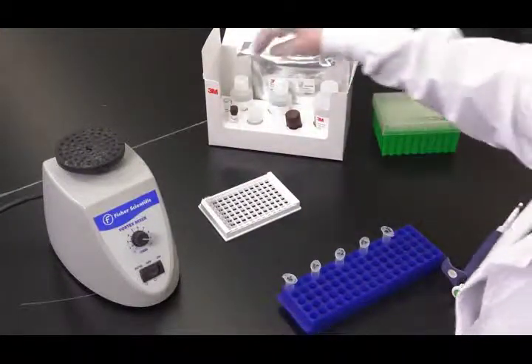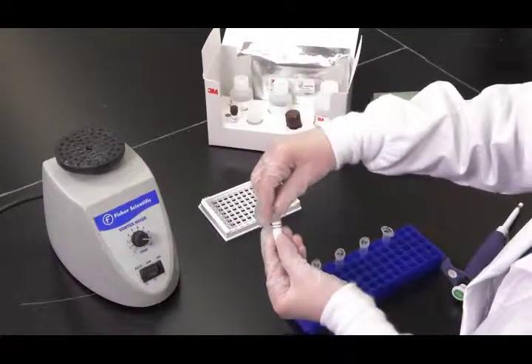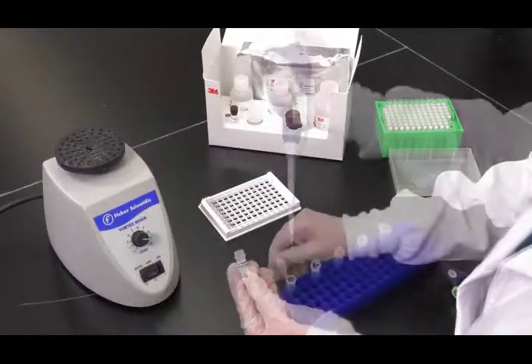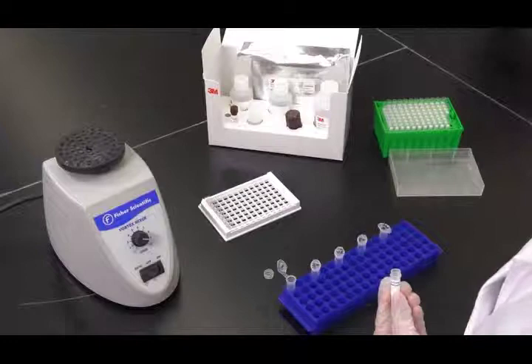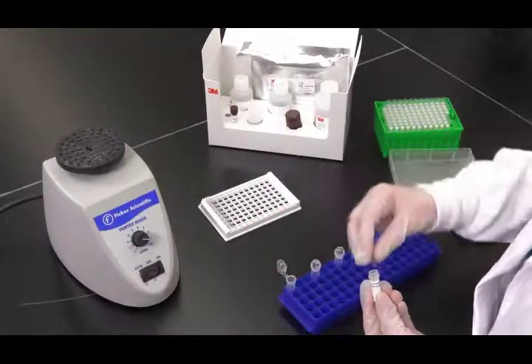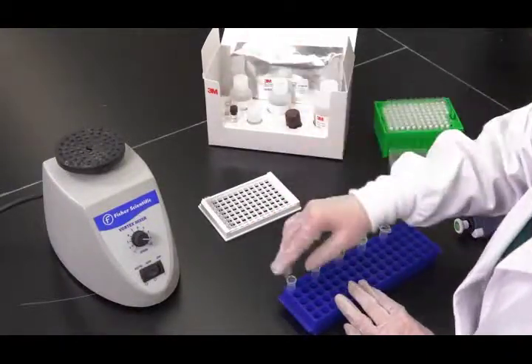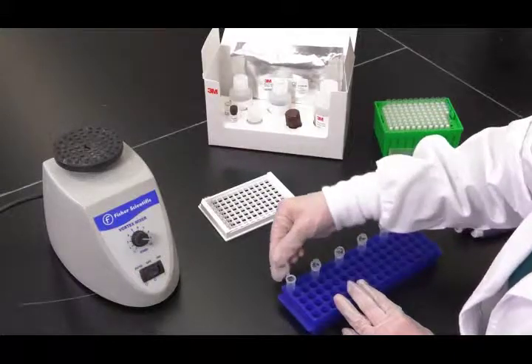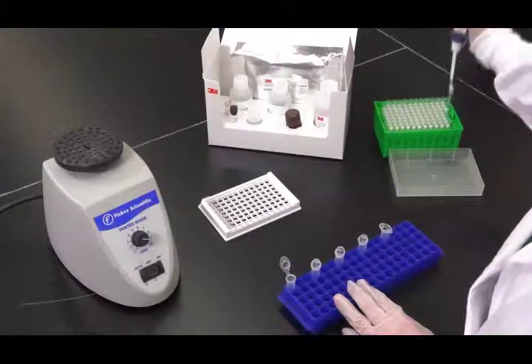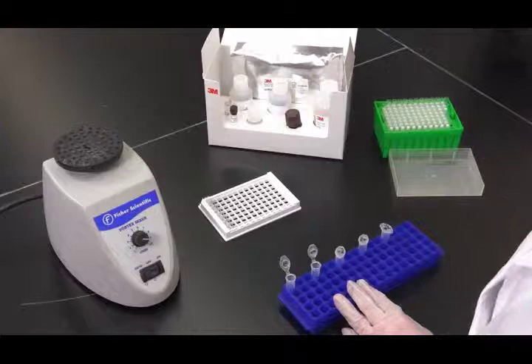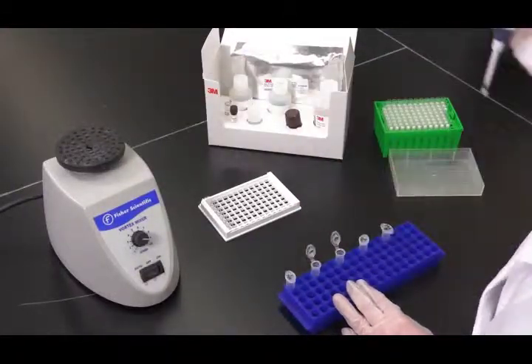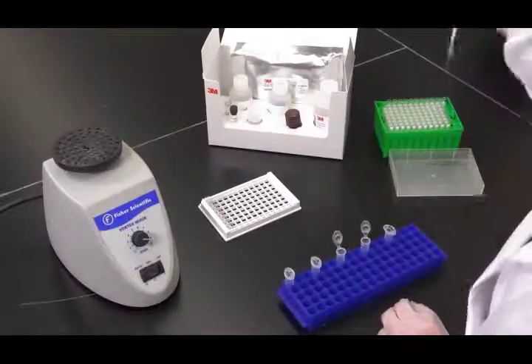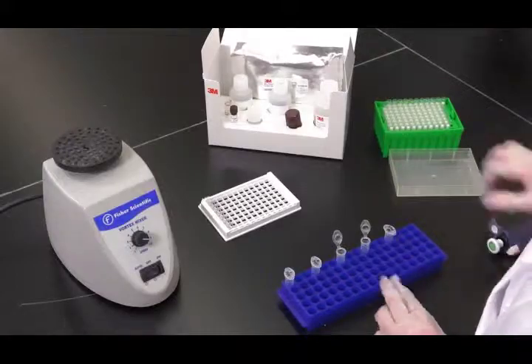Utilizing the 3M Allergen Protein Standard Concentrate, prepare a set of 4 or 5, depending on the kit, standards diluted in the 1X 3M diluent solution as described in the kit product instructions, and pipette 100 microliters of each standard into the 3M ELISA wells. Mix thoroughly between dilutions. The last tube only contains 1X 3M diluent solution and should be used as blank.